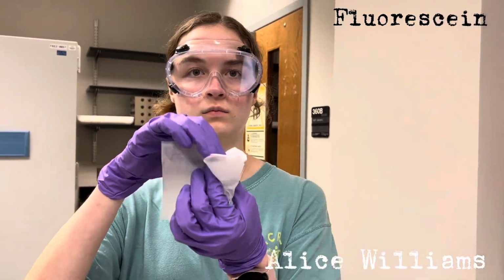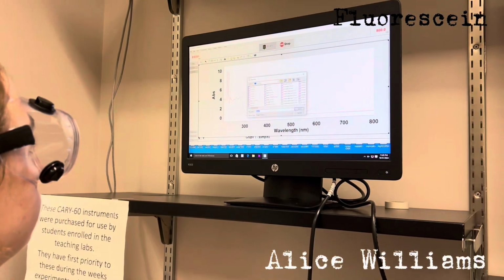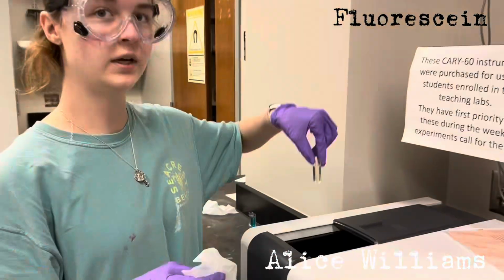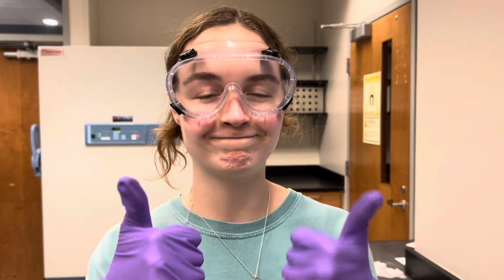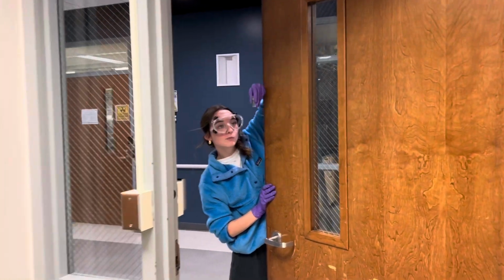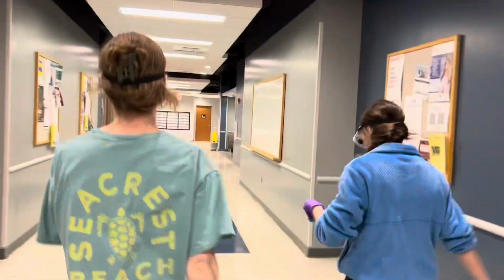So absorbance is directly proportional to concentration, and this linear relationship basically allows for determining unknown concentrations by measuring the absorbance and using the calibration curve. So failing to zero out this machine with a blank would affect the absorbance value by not accounting for possible background absorbance, and it can lead to inaccurate estimation and errors.